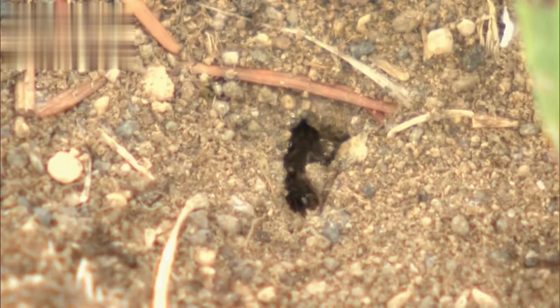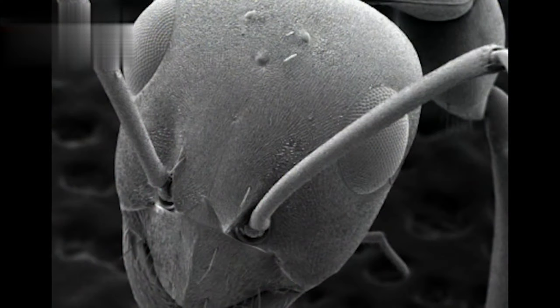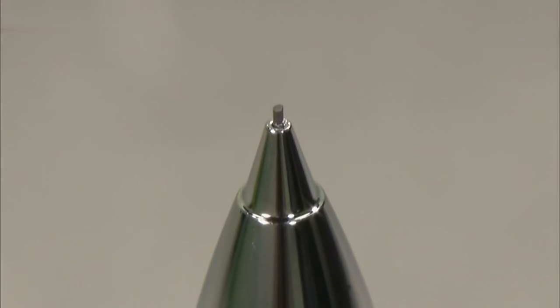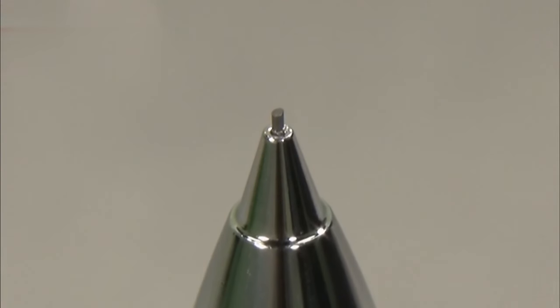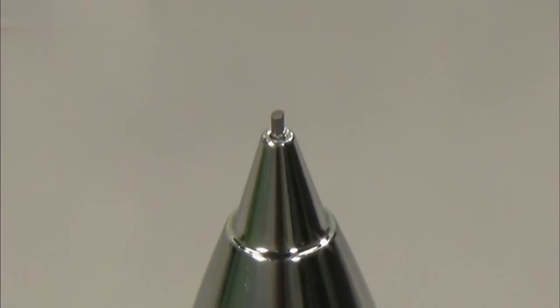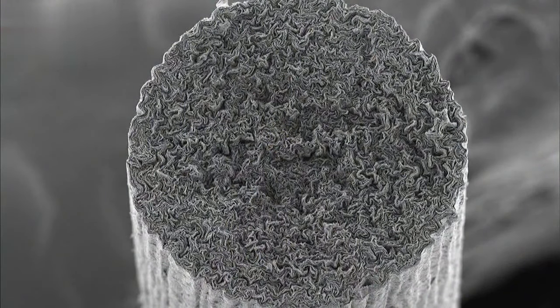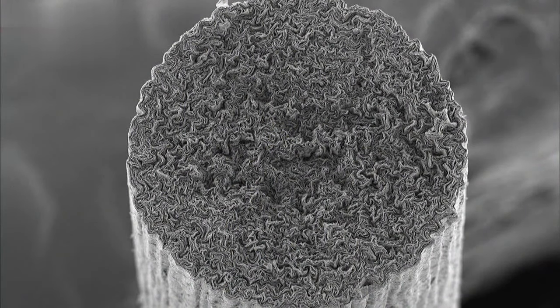You can also use an electron microscope to look at an ant and observe the eyes and antennae in detail. How about mechanical pencil lead? The cross section looks like this up close.